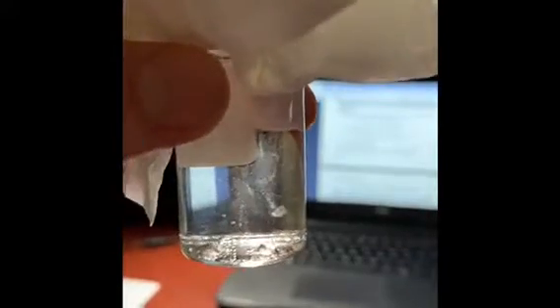But nonetheless, all of them are still pretty small, which isn't surprising, being that this was recorded 2 days after the lab. If you look at the liquid level in the solution, it hasn't gone down that much, so there's still a lot of evaporation left to do. So these will grow a lot more.